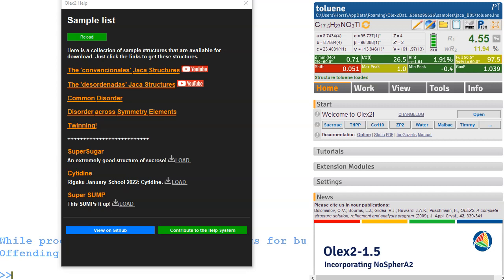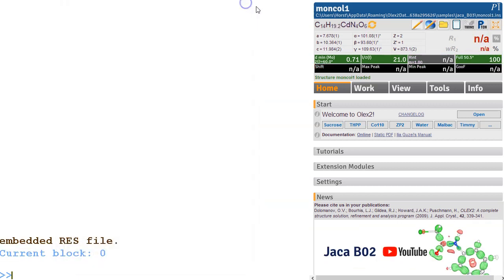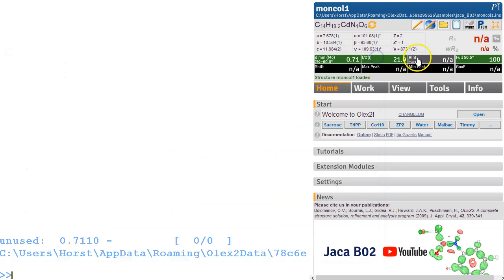Let's check out another disorder structure from the Jaca datasets, 03. I'm loading the structure, and what have we got? We have got cadmium. This looks like a cadmium complex. The cell 7, 10, 11. I over sigma looks pretty good. Resolution is quite high. It's merged data. I'm not sure why it's merged, but that doesn't matter too much.